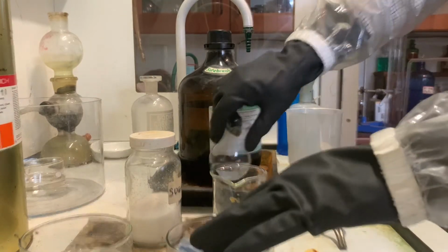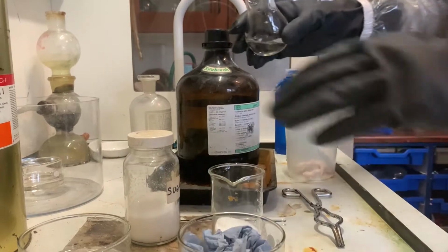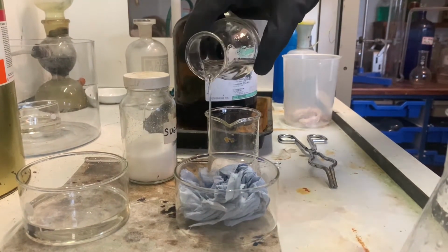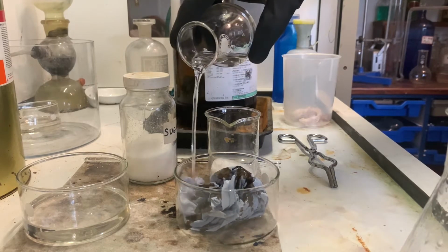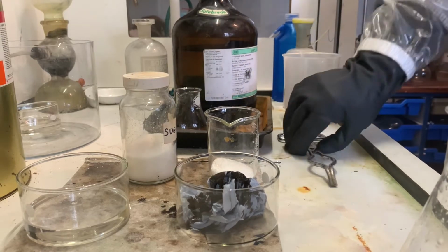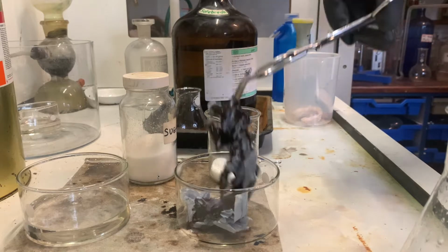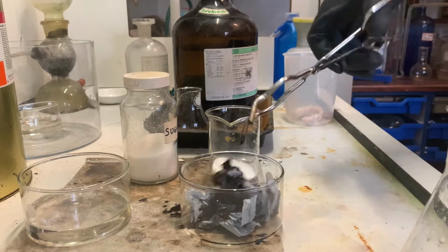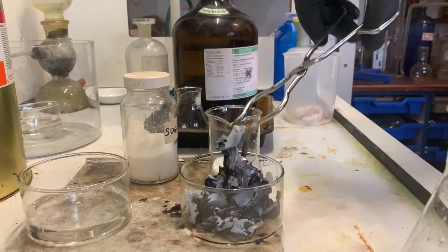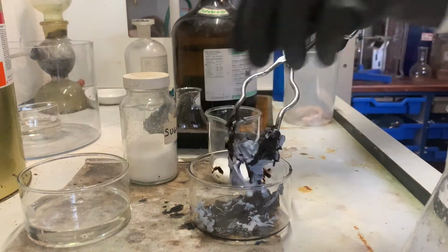Now, sulfuric acid has such an affinity for water. What I've got is just some normal tissue. I'm going to show you what would happen if I accidentally spilt some sulfuric acid and decided to then clean it up with some tissue or cloth. And as you can see, immediately the tissue has begun to dissolve. And what's actually happening is the cellulose molecules are being ripped apart, and the sulfuric acid has such an affinity for the water in it, the hydrogen and the oxygen, that it's turning it to pure carbon. As you can see, that's turned to pure slush.